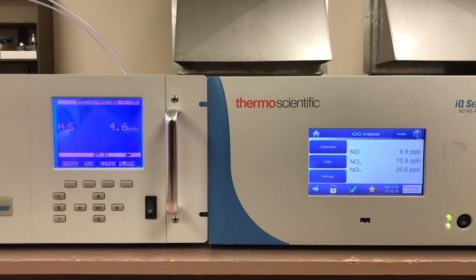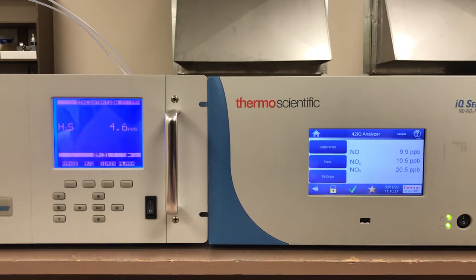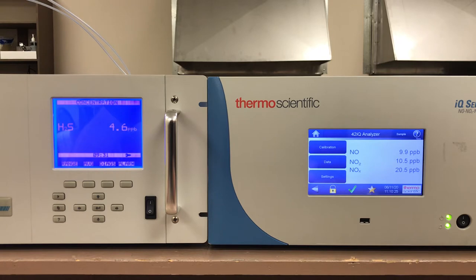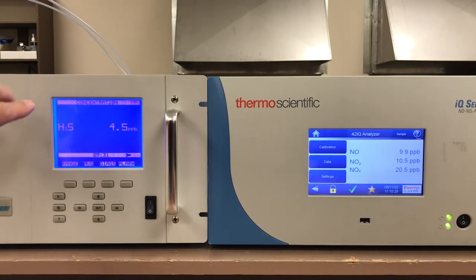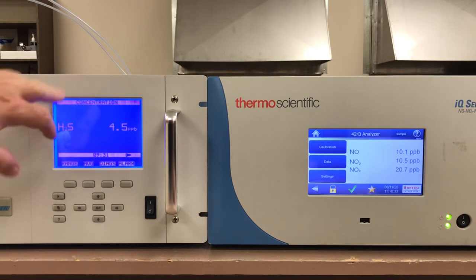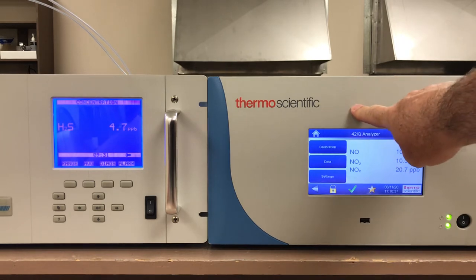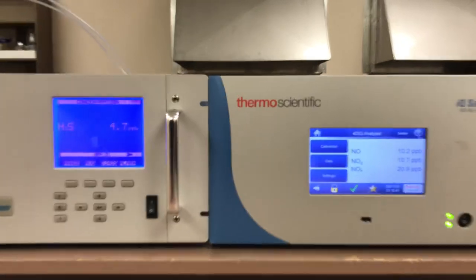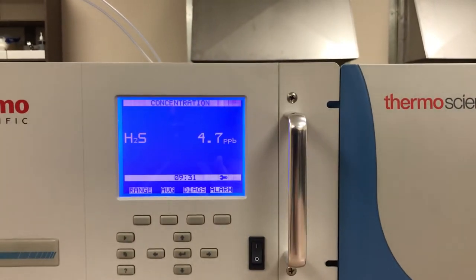Hi everyone, Jim with CD NOVA Instruments again. Today we're looking at the differences between the i-series and the i-Q series operation menus. On the left we have the model 450i H2S analyzer and on the right we have the model 42iQ NOX analyzer. If we come in a little closer, I'll look at the i-series menu first.